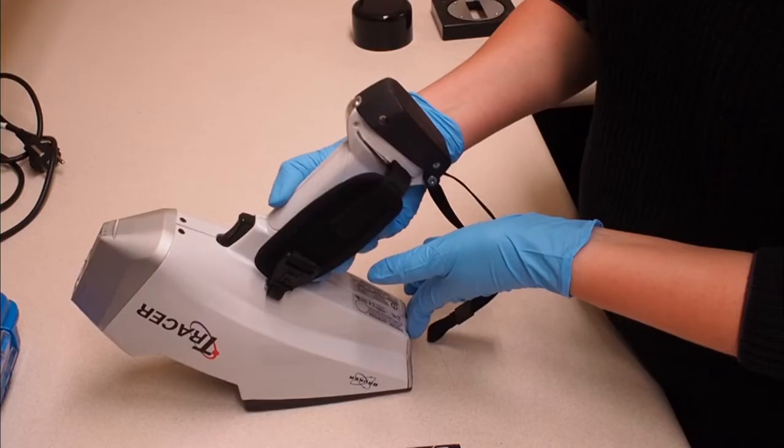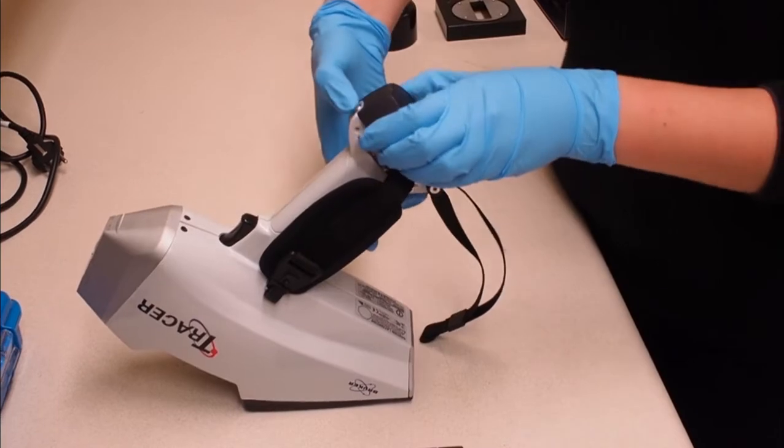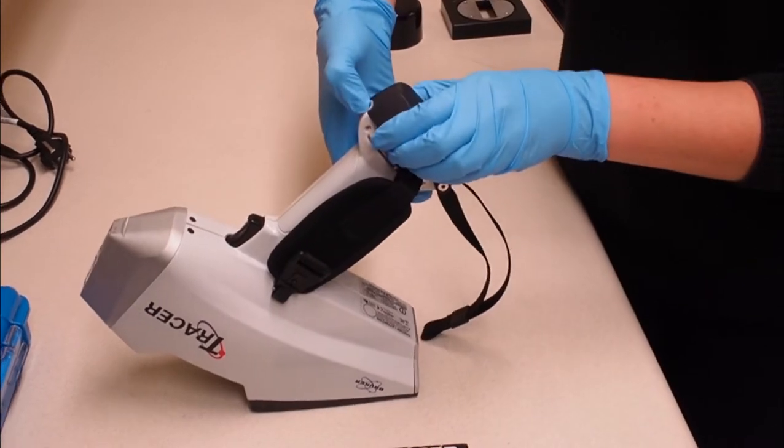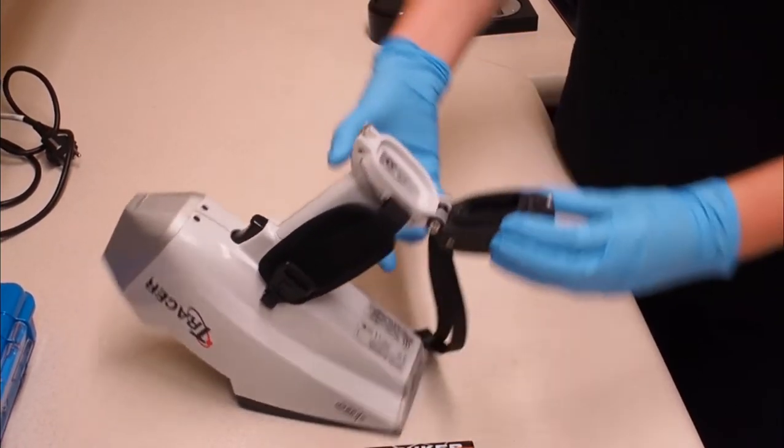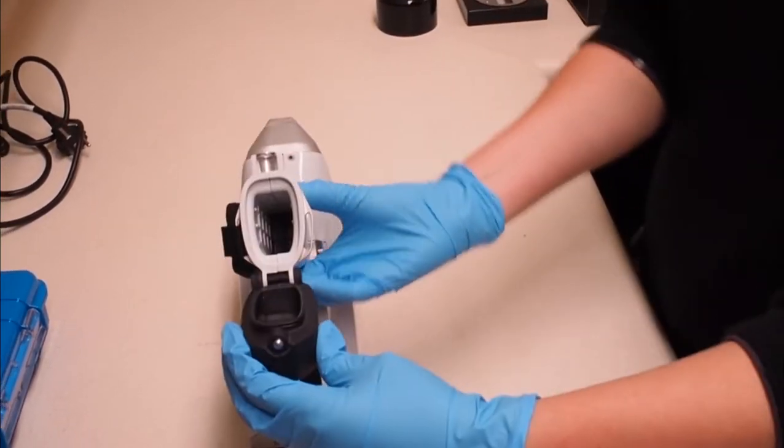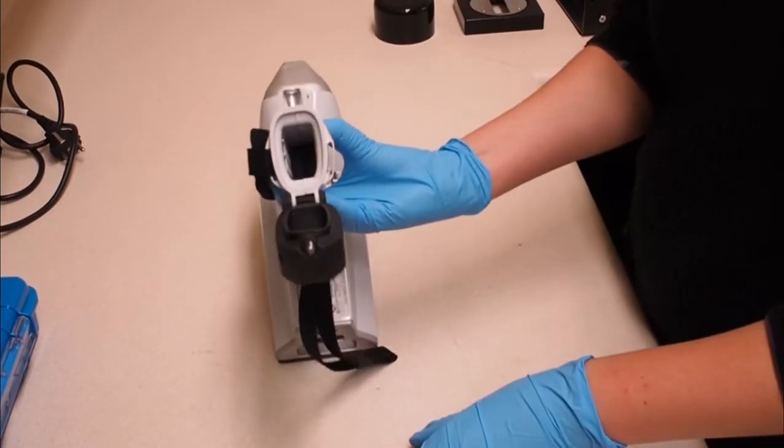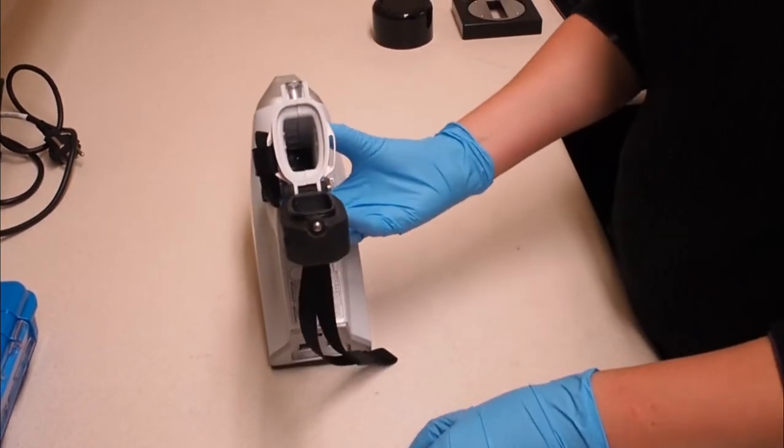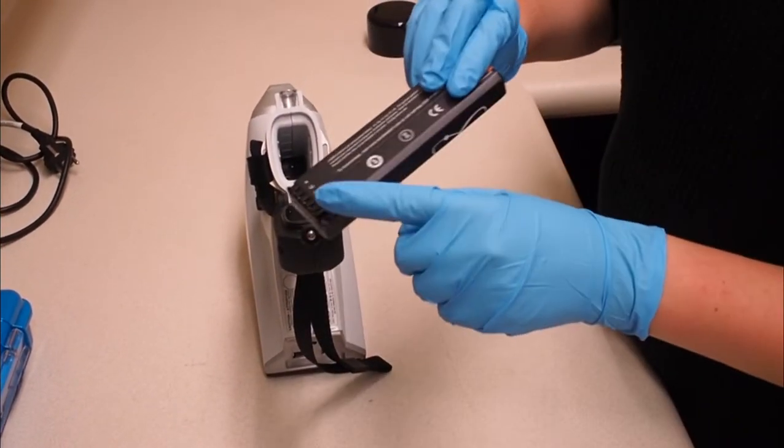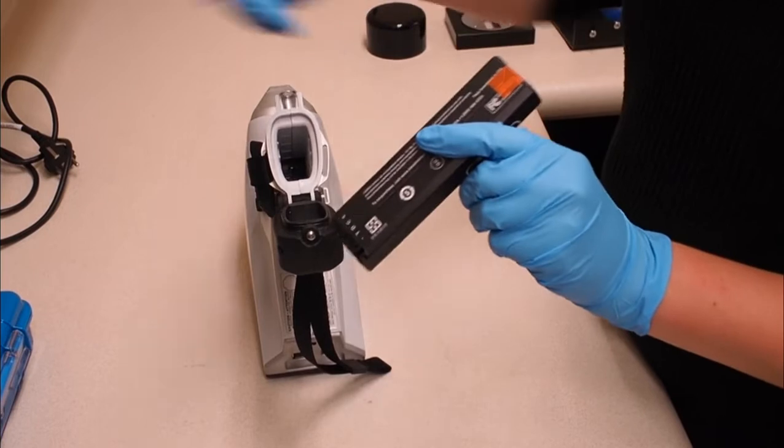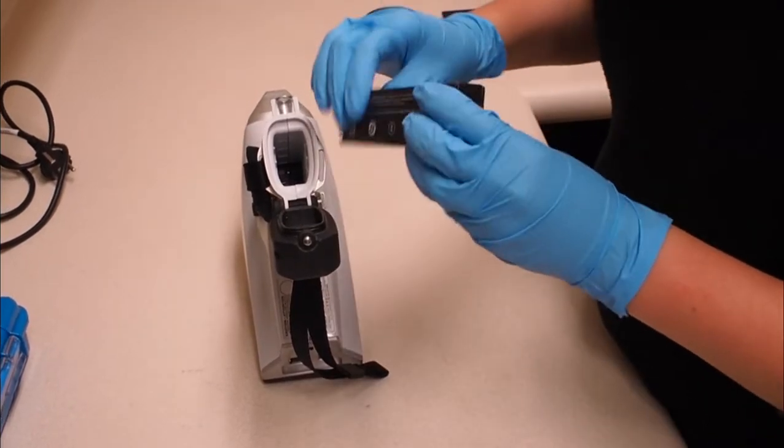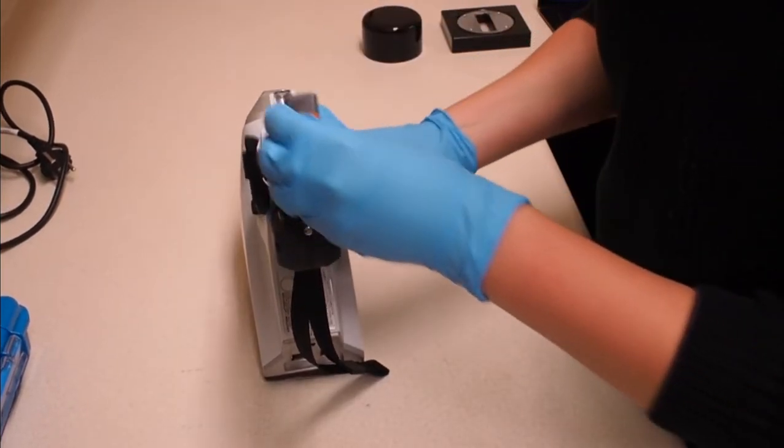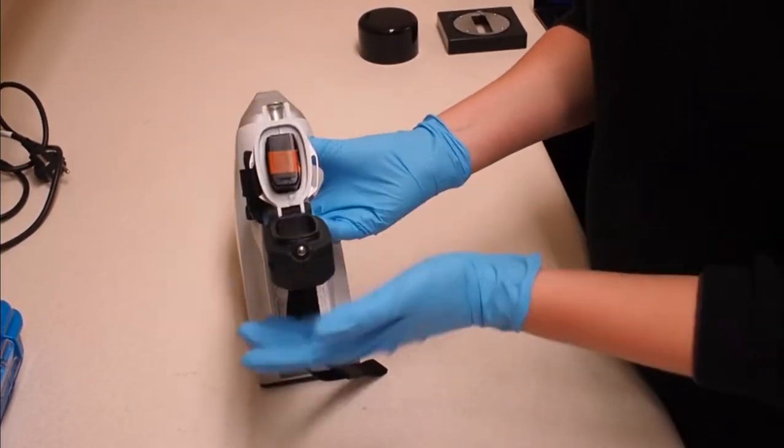To insert the battery, depress the button at the base of the instrument handle to open the battery compartment. The battery can only be inserted one way. To check the battery is going in the correct way, make sure the slots on the battery align up with the pins at the bottom of the battery instrument shaft.